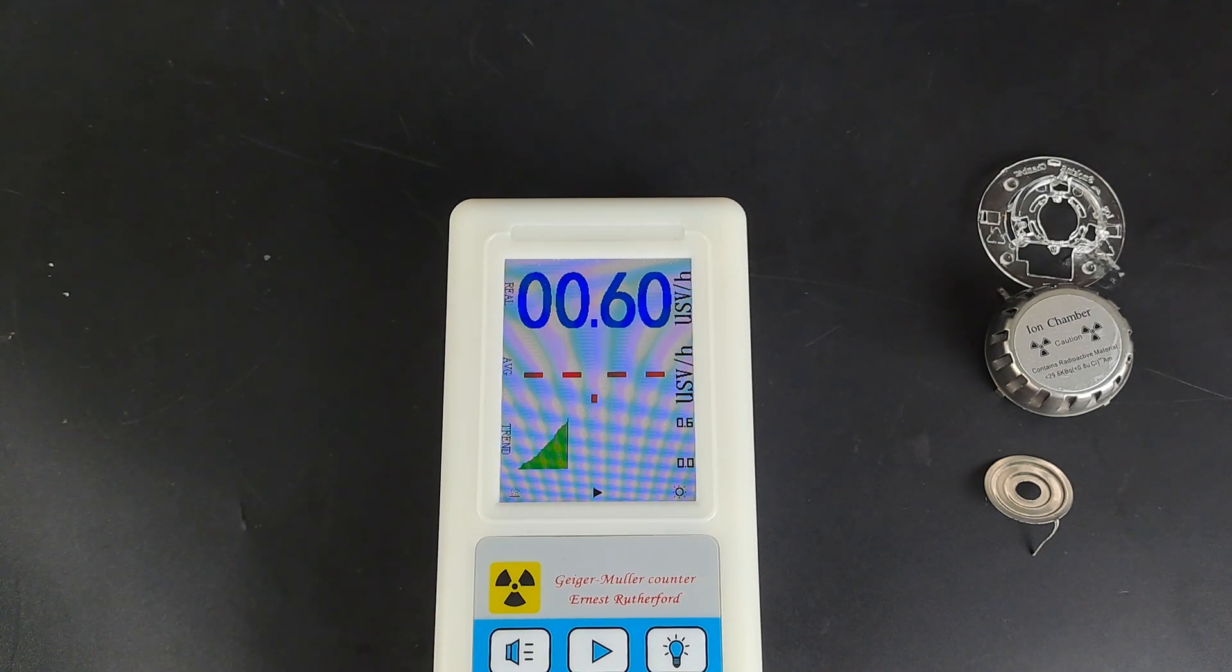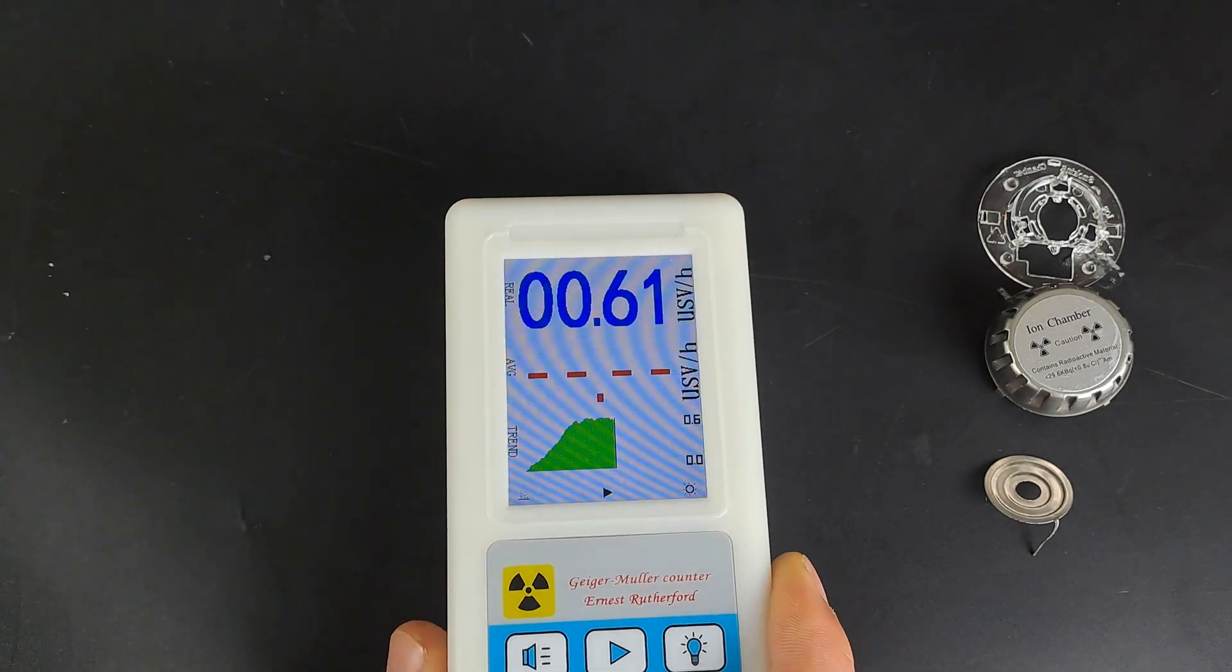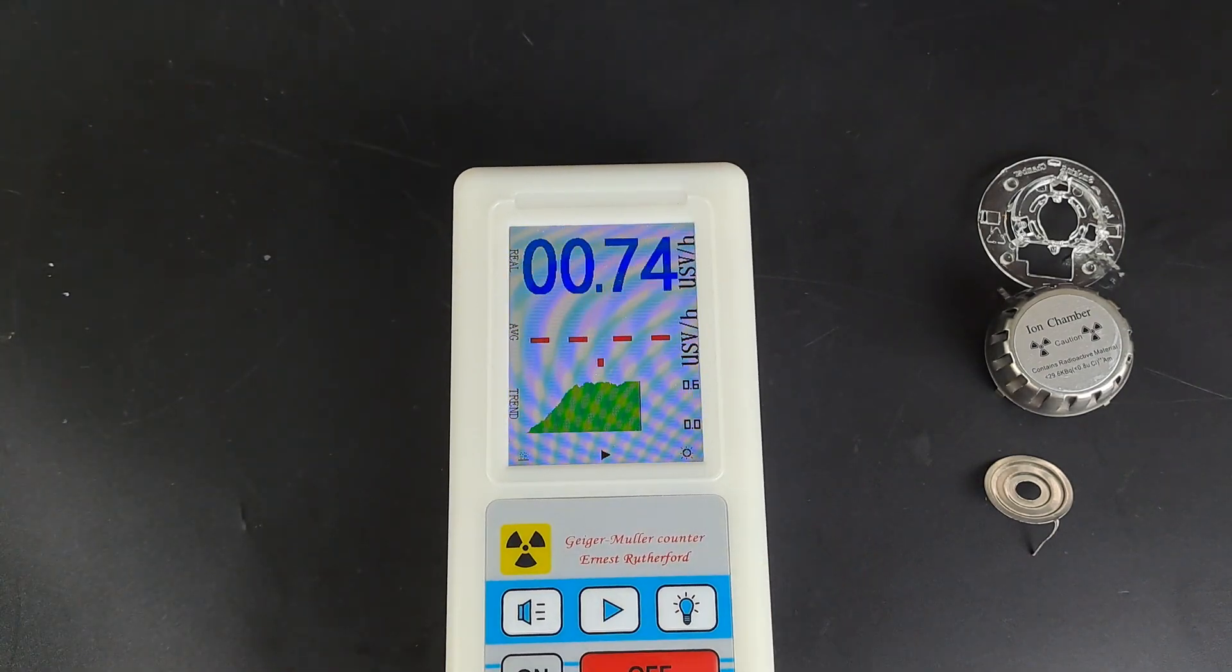Even my cheap Geiger counter can detect that this thing is radioactive. But of course I wanted to know exactly what's in there and how much of it is in there.